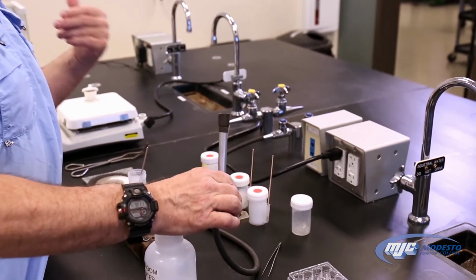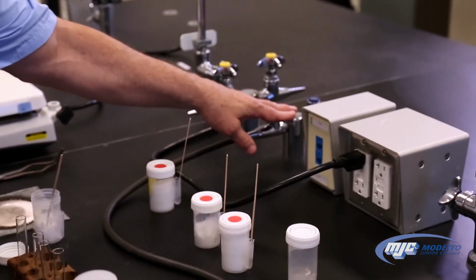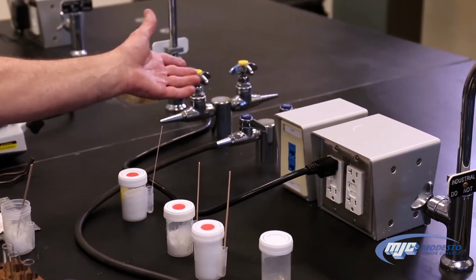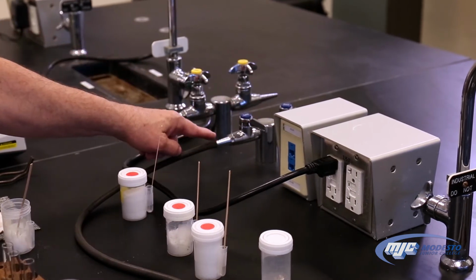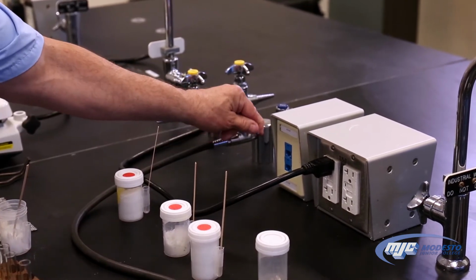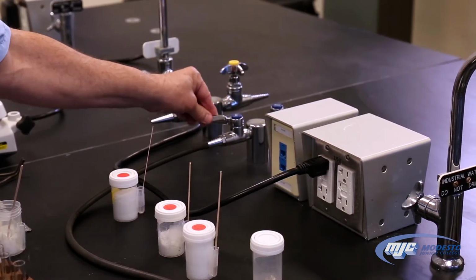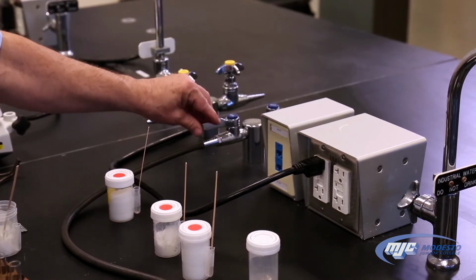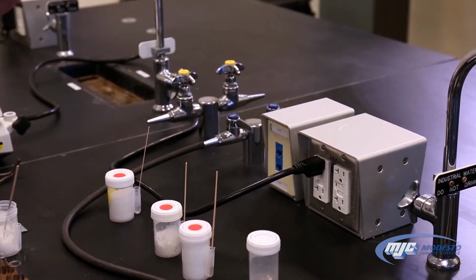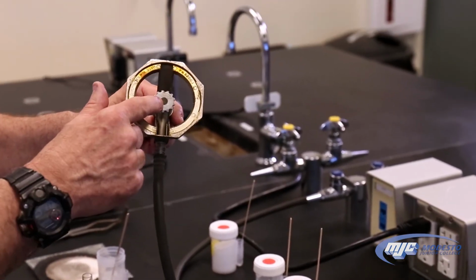And a Bunsen burner basically has 3 controls. The first control is the handle to the Bunsen burner. It's either on or off, and that's it. If this handle is perpendicular to this nozzle, either way, it's off. If this handle is parallel to this nozzle, it's on. That's it. We don't try to control the flow with that. That's the first control.